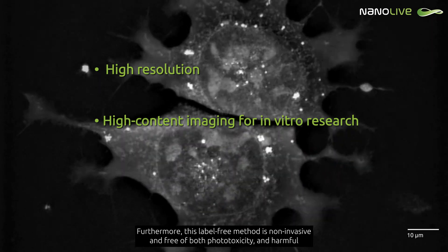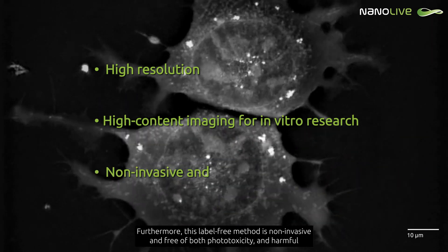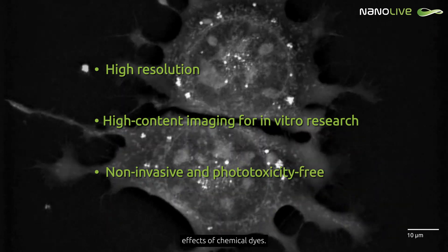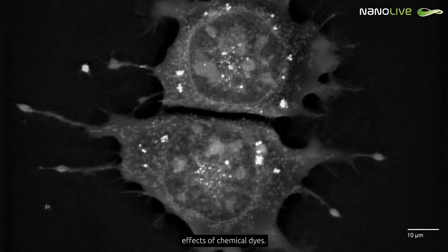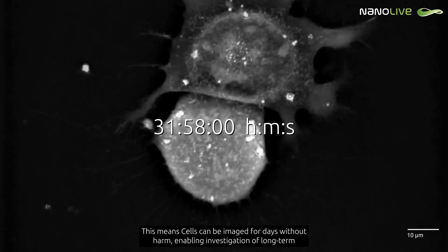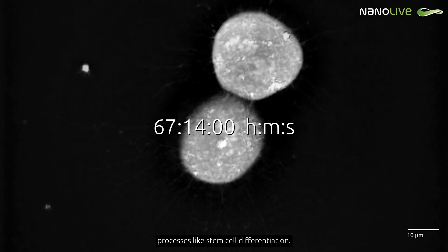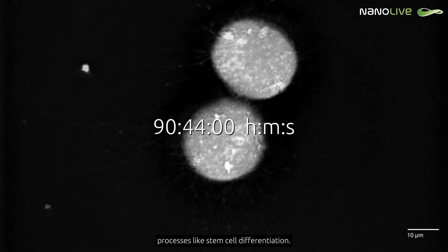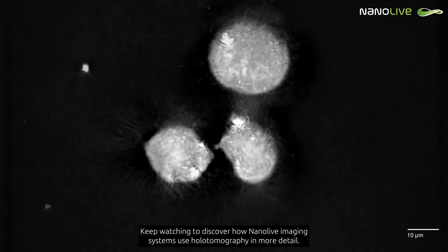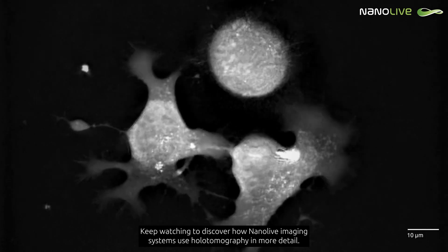Furthermore, this label-free method is non-invasive and free of both phototoxicity and harmful effects of chemical dyes. This means cells can be imaged for days without harm, enabling investigation of long-term processes like stem cell differentiation. Keep watching to discover how Nanolive imaging systems use holotomography in more detail.